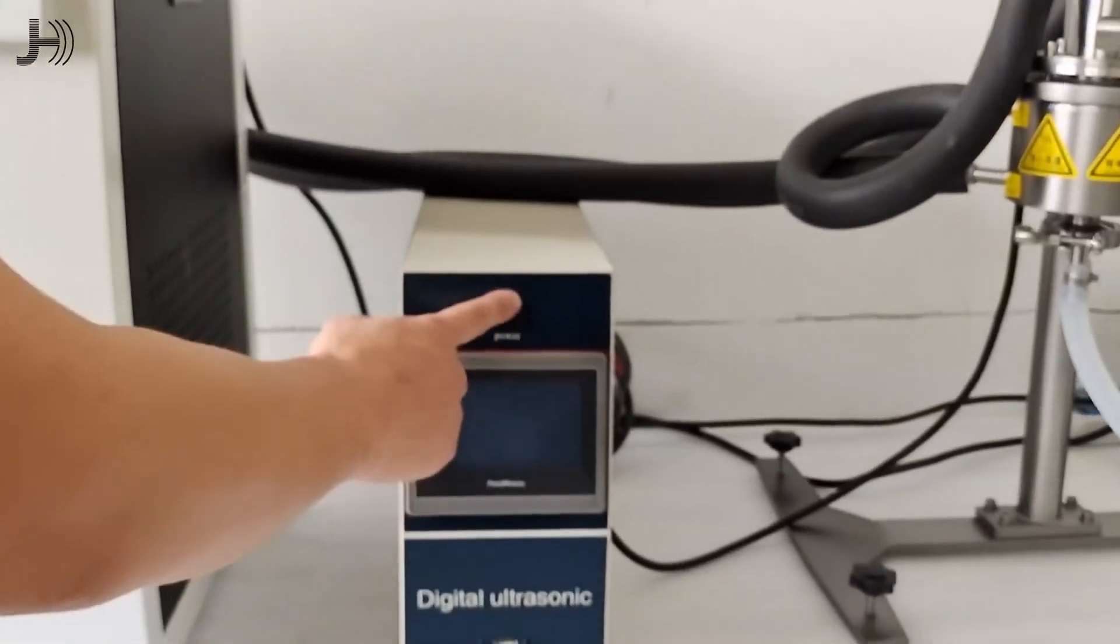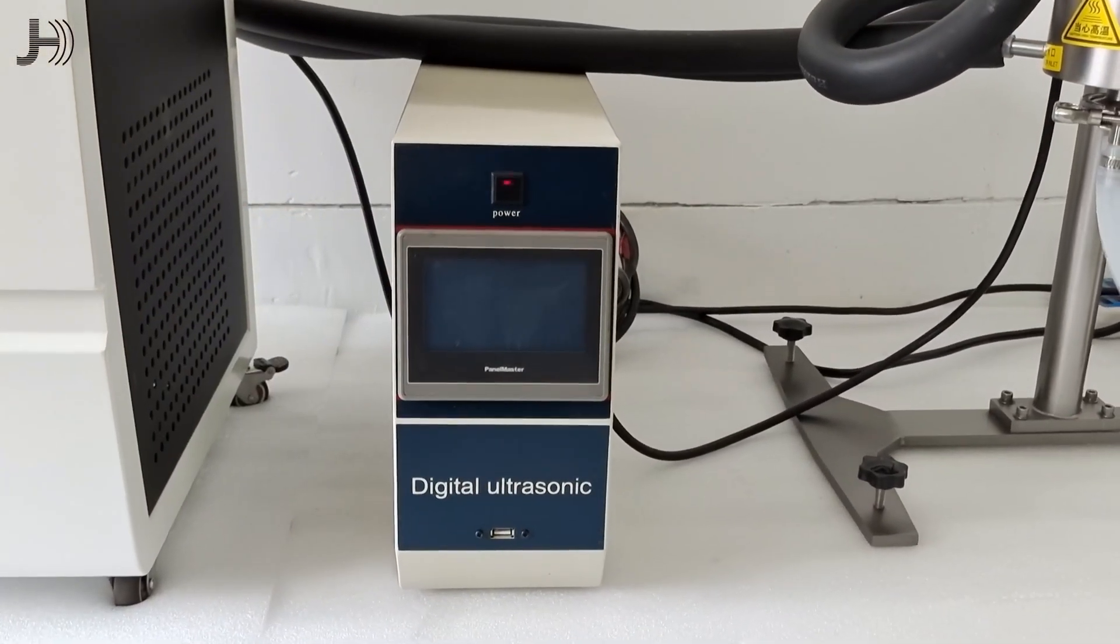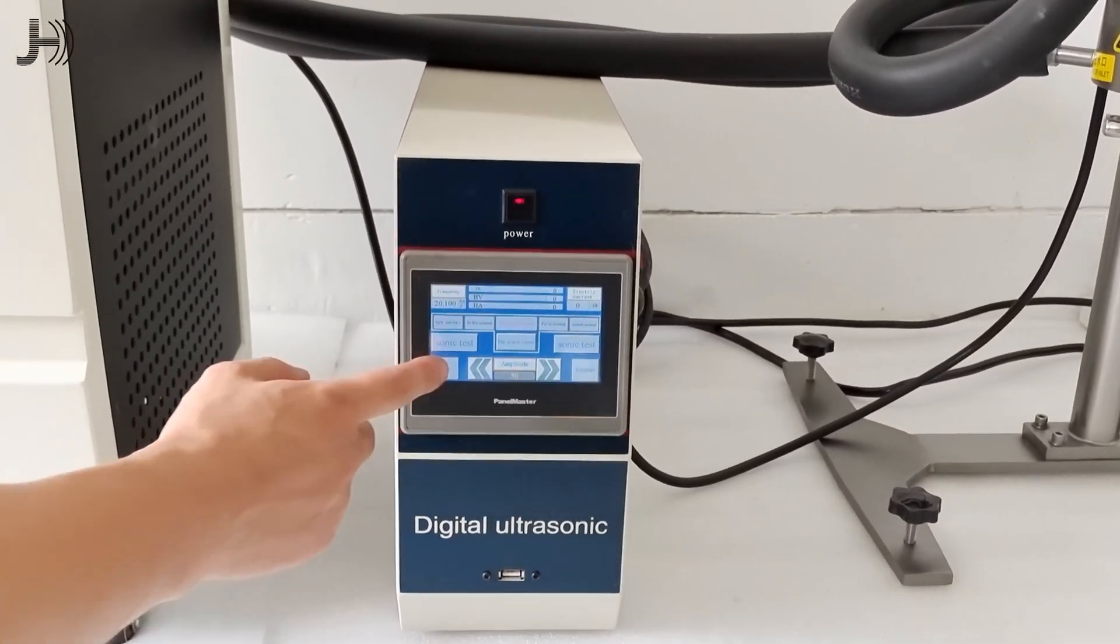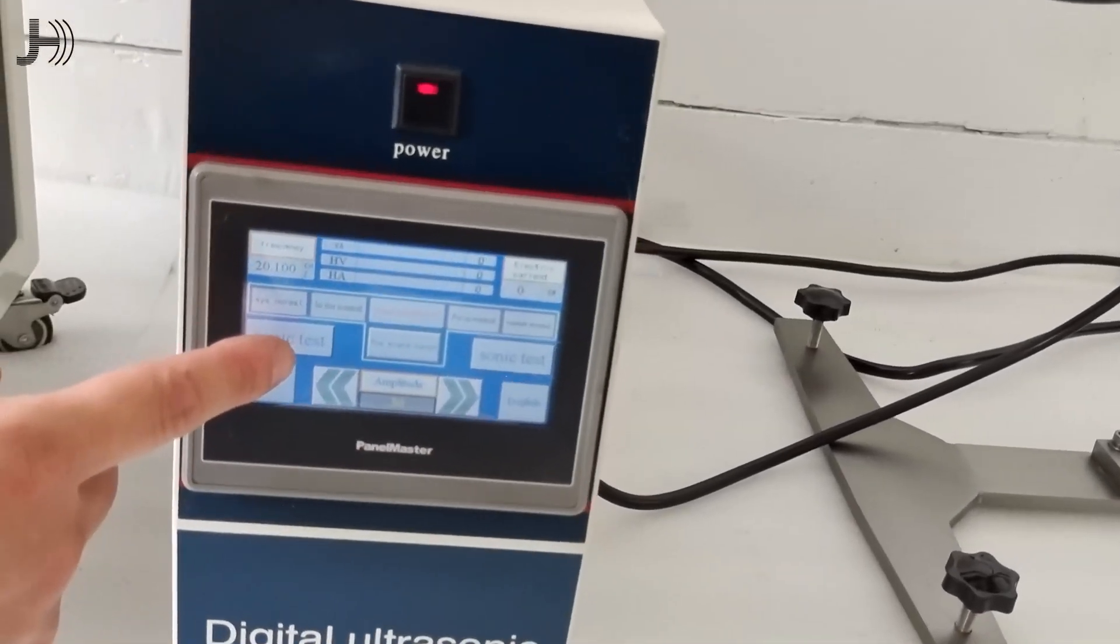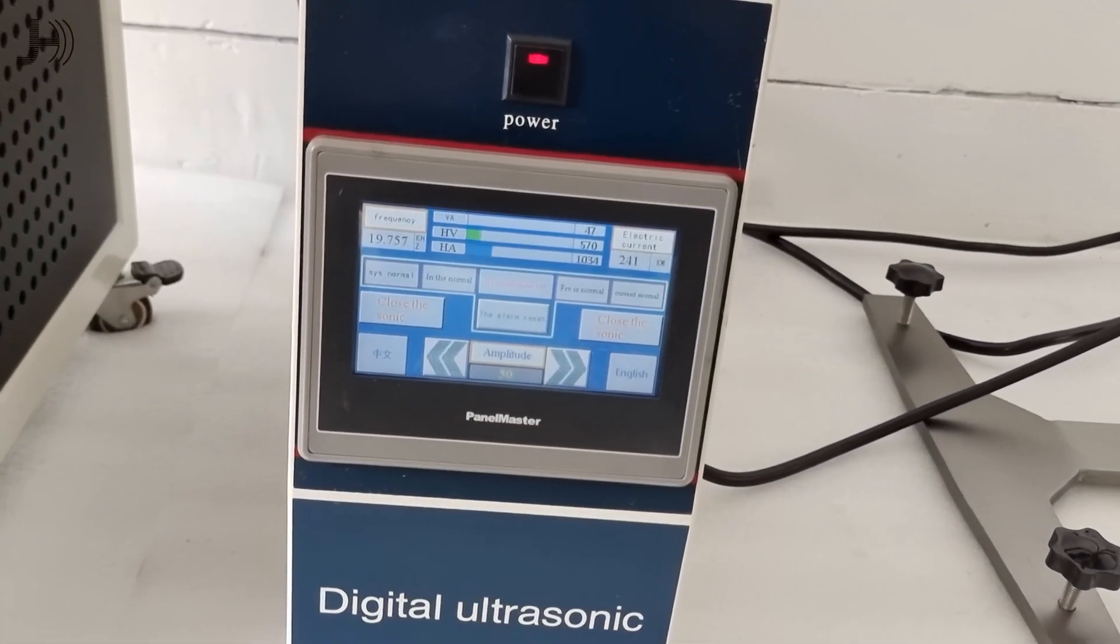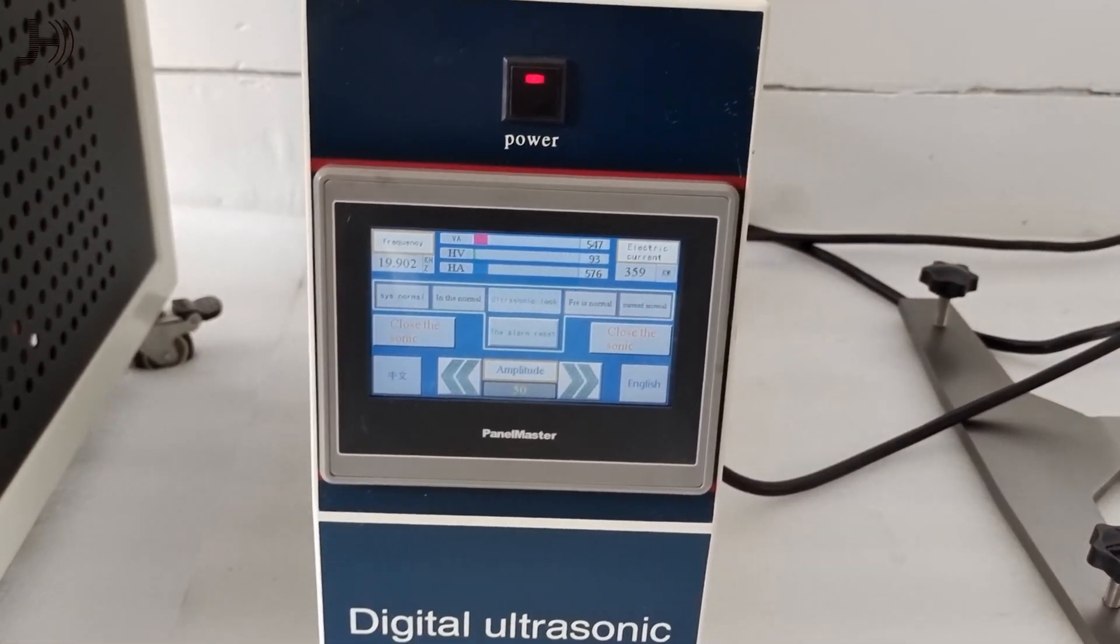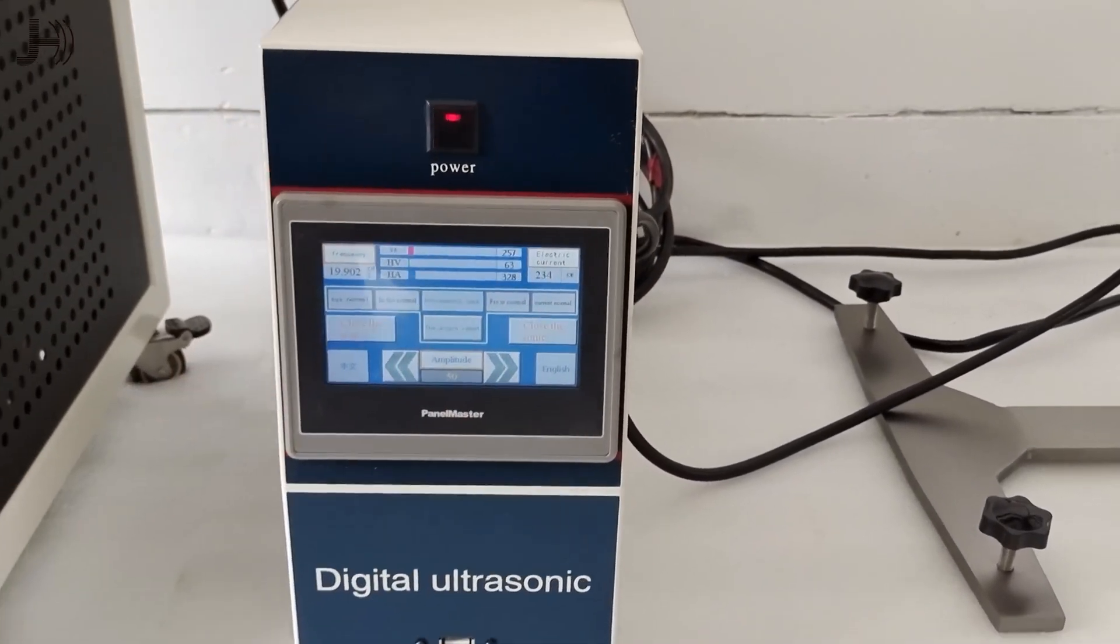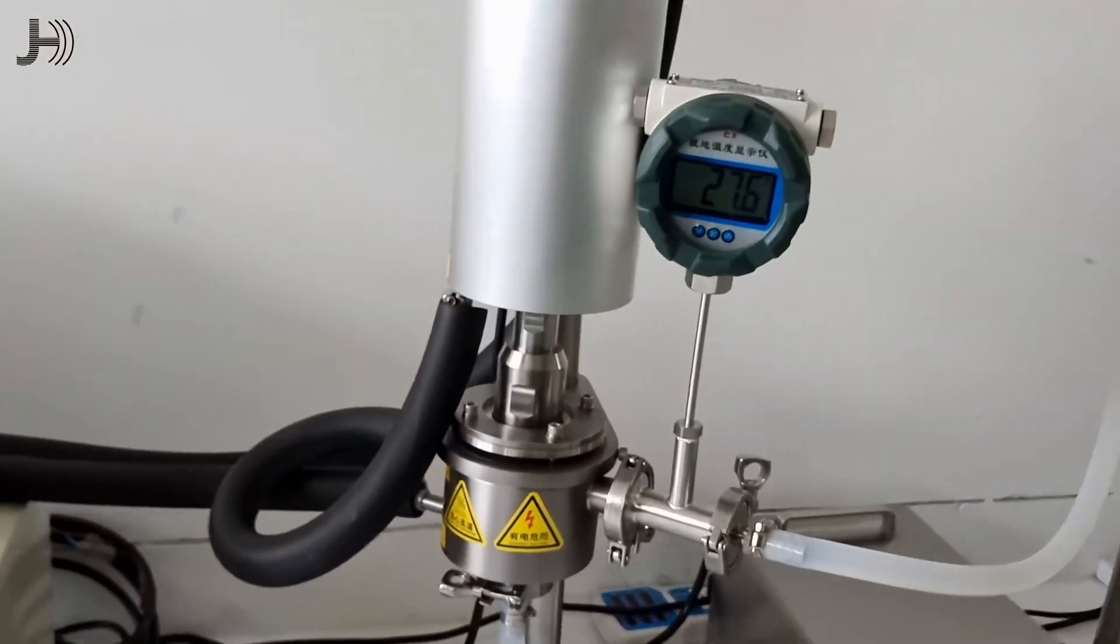Turn on the ultrasonic generator. Choose language to English and test the sonic. Open sound. It works.